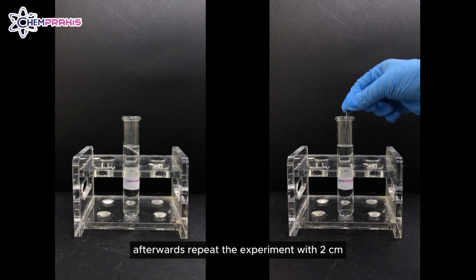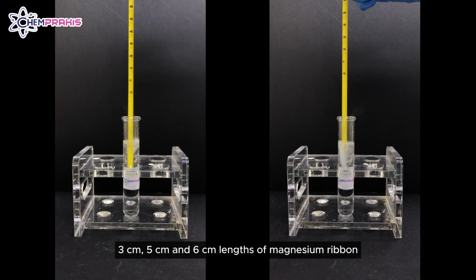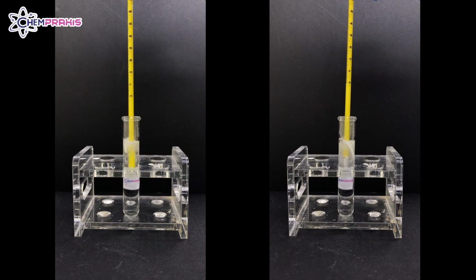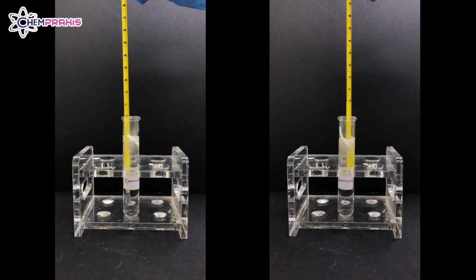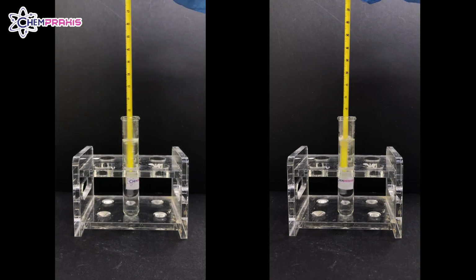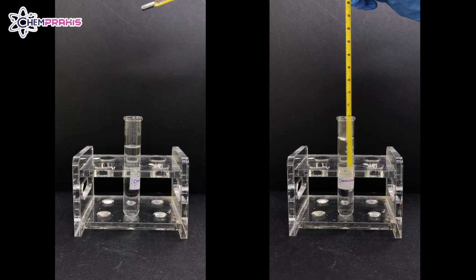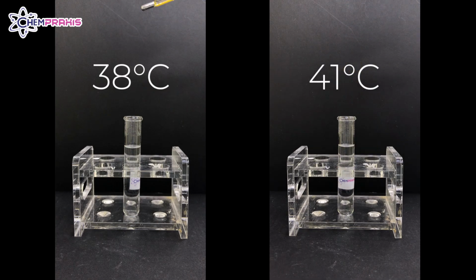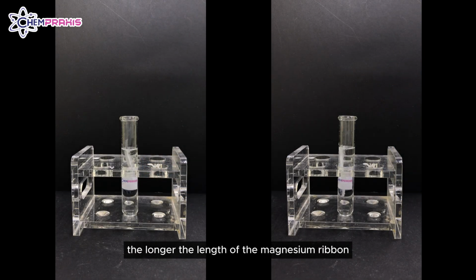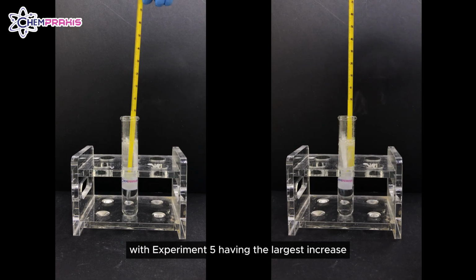Afterwards, repeat the experiment with 2 cm, 3 cm, 5 cm, and 6 cm lengths of magnesium ribbon. In this experiment, we can see that the longer the length of the magnesium ribbon, the higher the temperature increase, with experiment 5 having the largest increase.